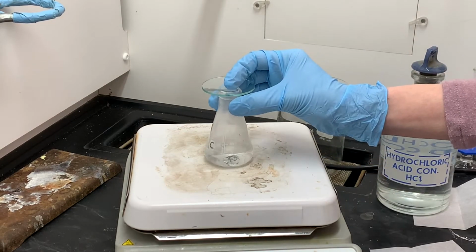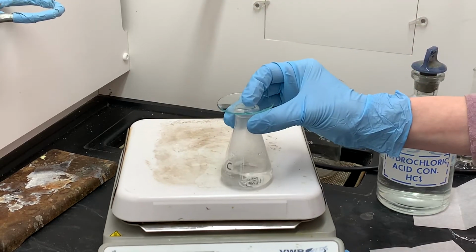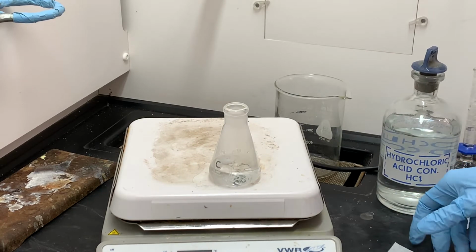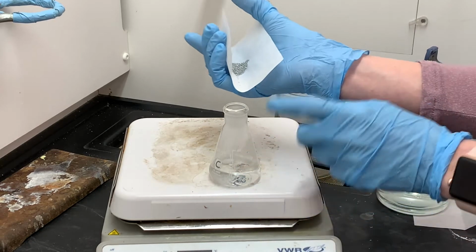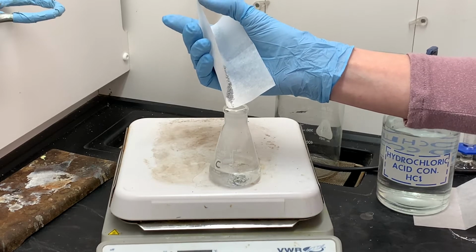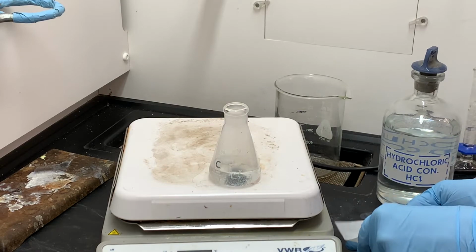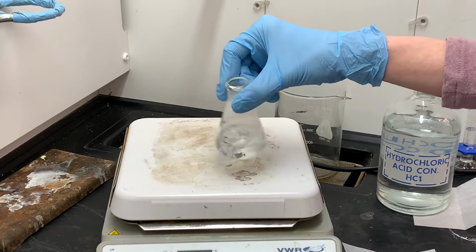The maleic anhydride is done dissolving, so now I'm just going to move this flask to the front of the hot plate where it's not so hot. And next I'll be adding the zinc. I want to add the zinc in 3 or 4 portions. I don't want to add it all at once, so I'm just going to pour some of it in, and then after each one of the additions of zinc, I will be swirling it around, mixing the solution together. However, the zinc is not going to dissolve at this time.